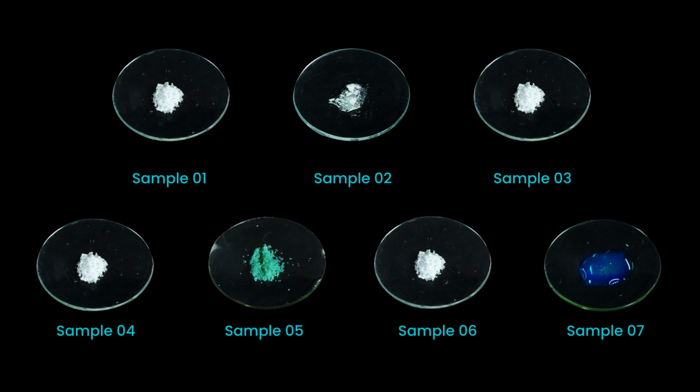Before we begin, let me ask you a question. Can the color and nature of the samples be used to identify them? Despite its limitations, identifying samples purely by their color and nature can provide initial data for further investigation. Color can serve as a preliminary indicator. One of the samples is green in color, and the solution has a light blue color, however, it is insufficient for a conclusive identification. I remind you, why do we carry out a flame test for metal cations? The answer is to identify the metal cations by their distinctive flame color.